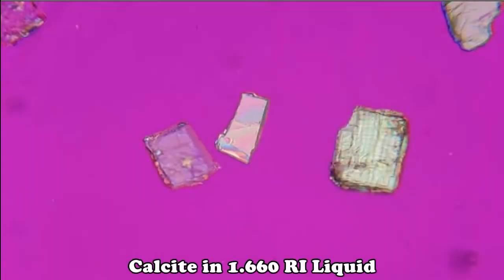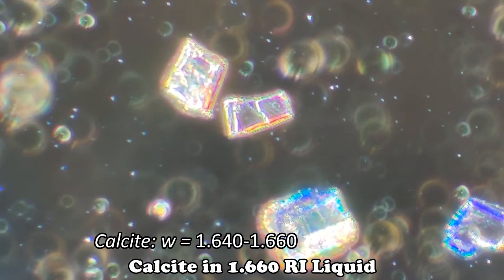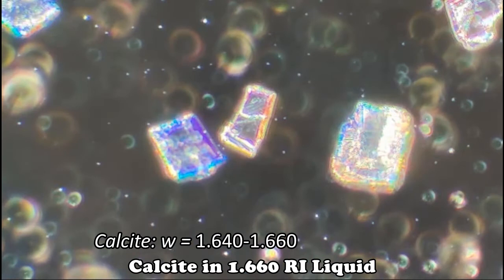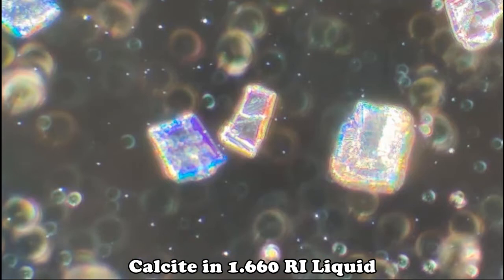Now let's take a look at the refractive indices. Because the refractive index of the omega axis of calcite is between 1.64 and 1.66, you can see the dispersion staining colors of blue to magenta appear.